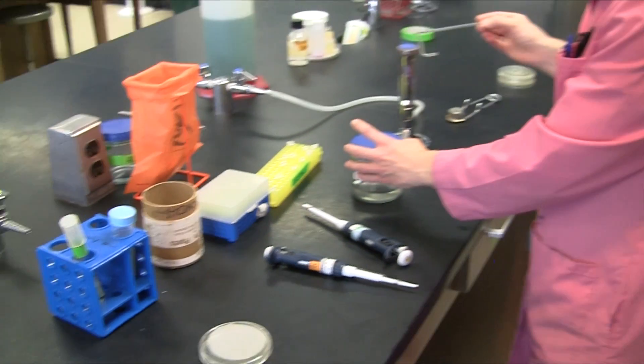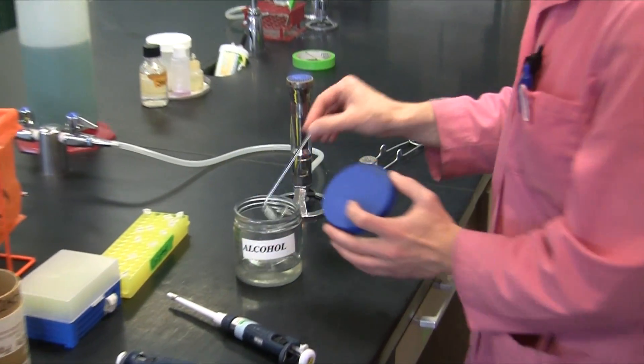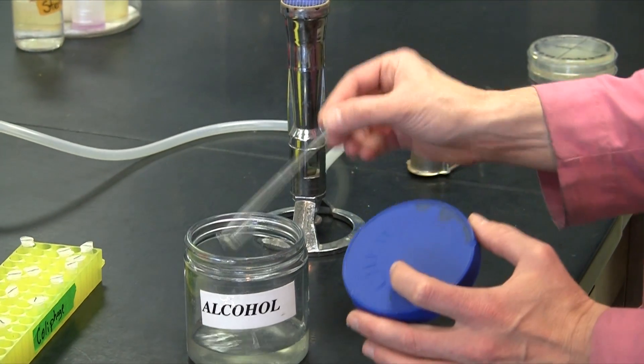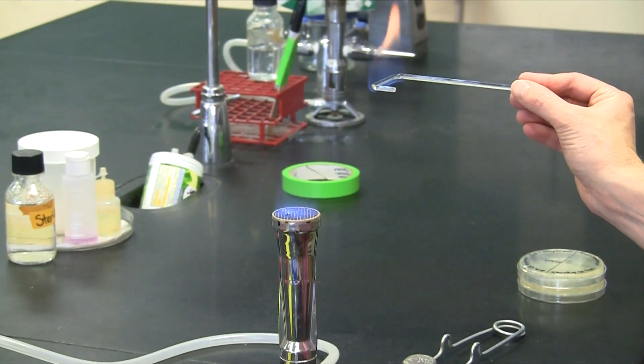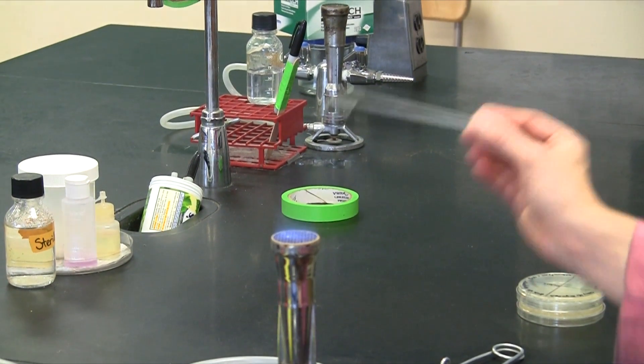Because bacteria are where it's at. Now in order to sterilize the bar, we'll dip and flame one more time, and you can put this aside. You're all done with it.